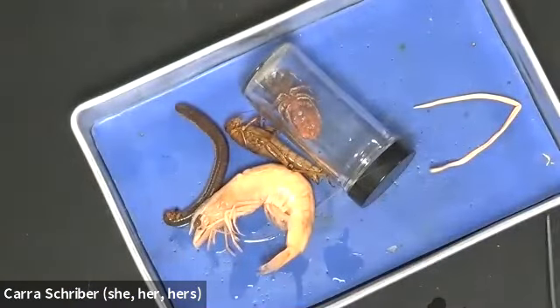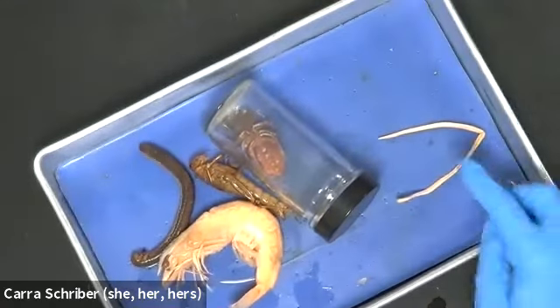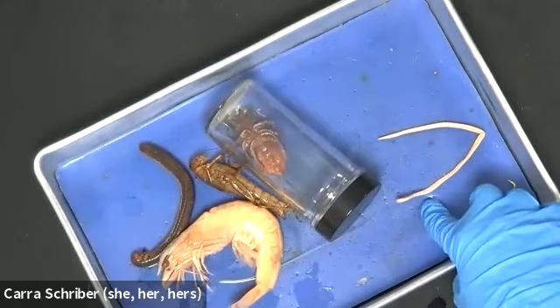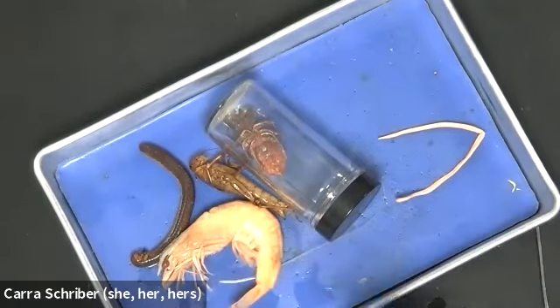Okay, so the question is, what do all of these things have in common? Well, they all have this crunchy outer layer, which is what sheds. So these are surprisingly going to be related to our roundworm. And we talked about with the roundworm, we shed the cuticle or the outer layer, right? And in the insects, we shed the outer layer, but it's the harder outer layer, right?